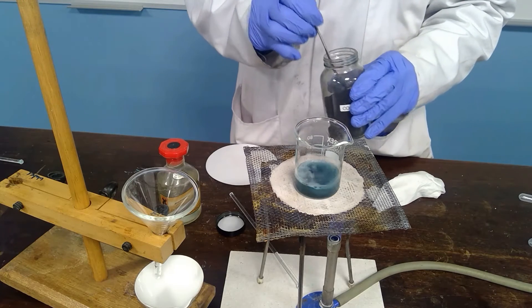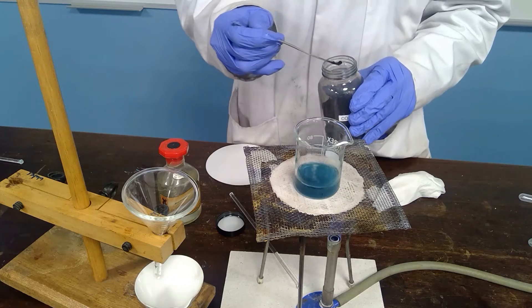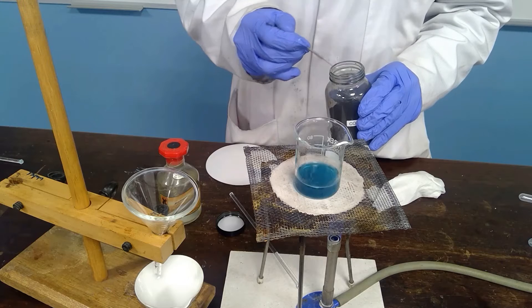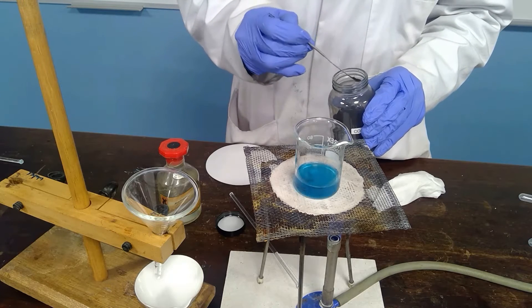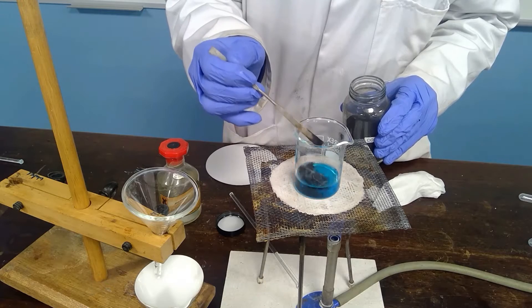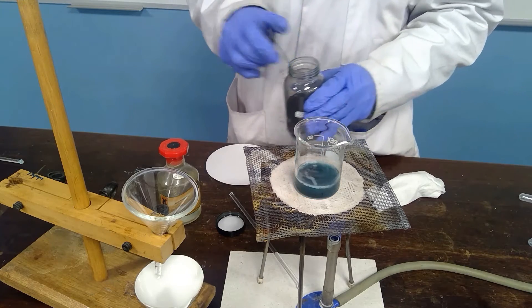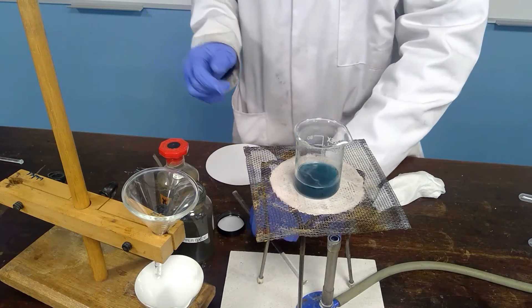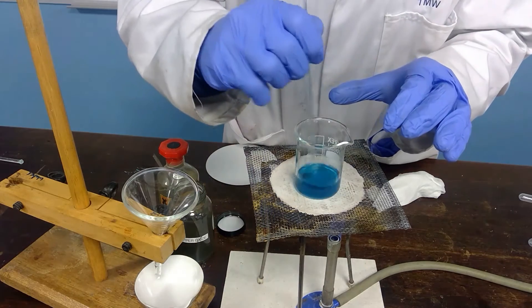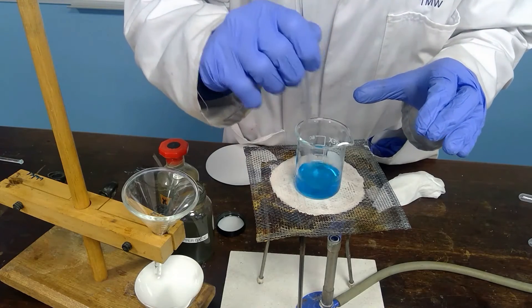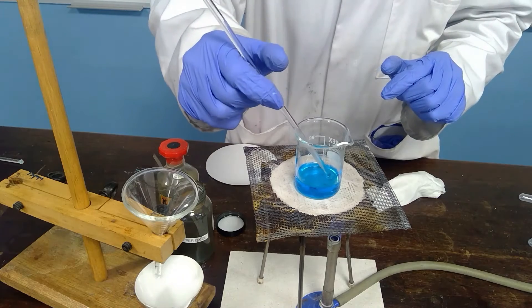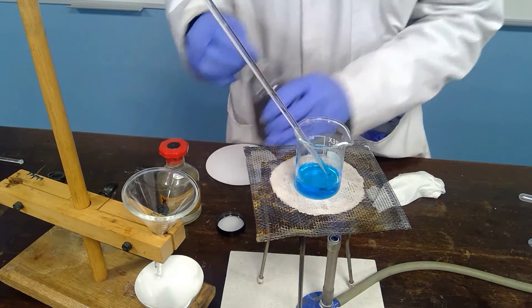Our ultimate aim in doing this is to completely neutralize the sulfuric acid and we will know this when the copper oxide no longer reacts and because it's insoluble in water we will see it left in the bottom of the beaker. At this stage it is still disappearing. So we continue to add.